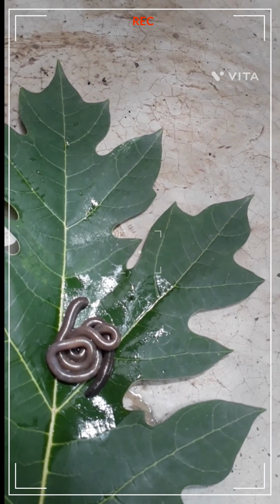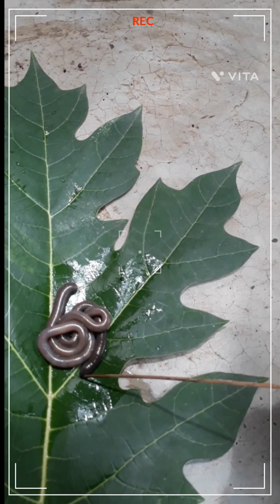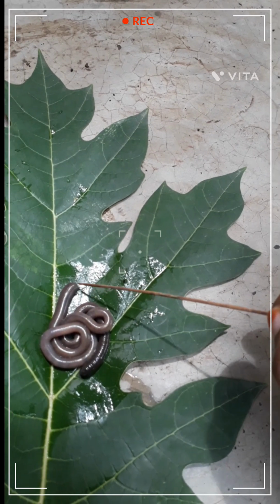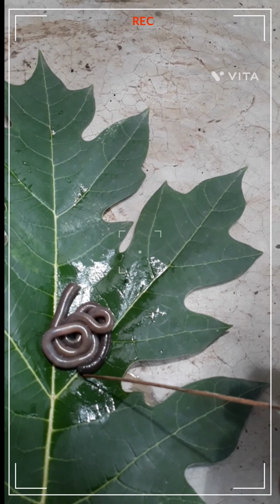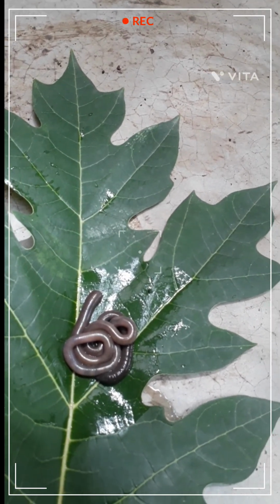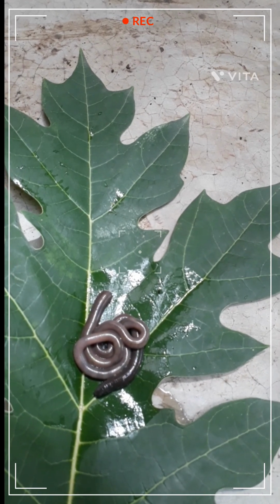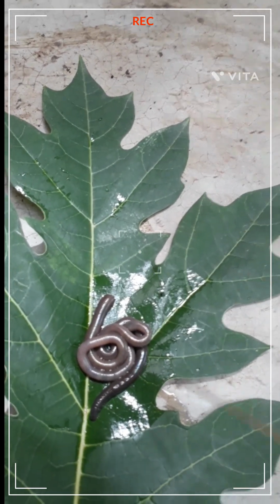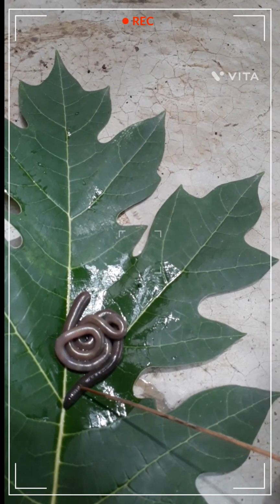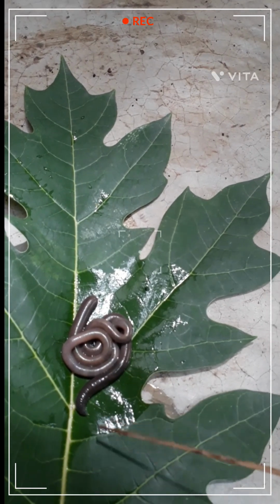Integumentary nephridia are attached to the lining of the body wall from segment 3 to the last, and open to the body surface. This is the segment 3. From here to here, the integumentary nephridia are attached to the body of the earthworm. Pharyngeal nephridia are present as 3 paired tufts in the 4th, 5th and 6th segments. They are present inside the body, so I am not able to show them.